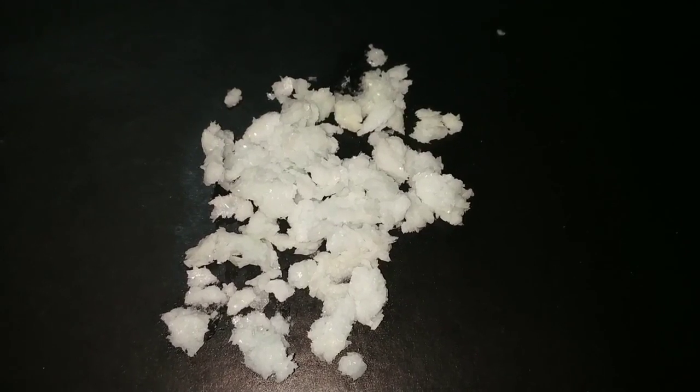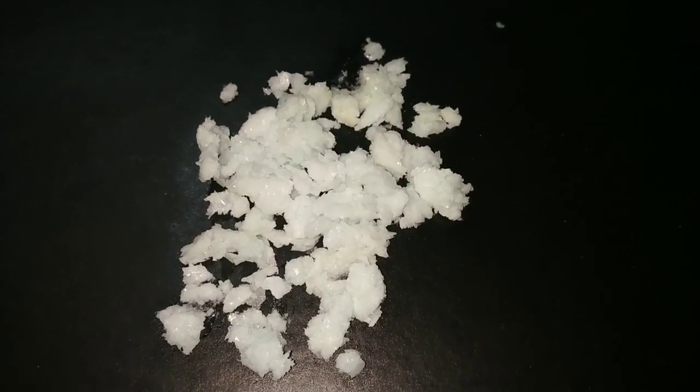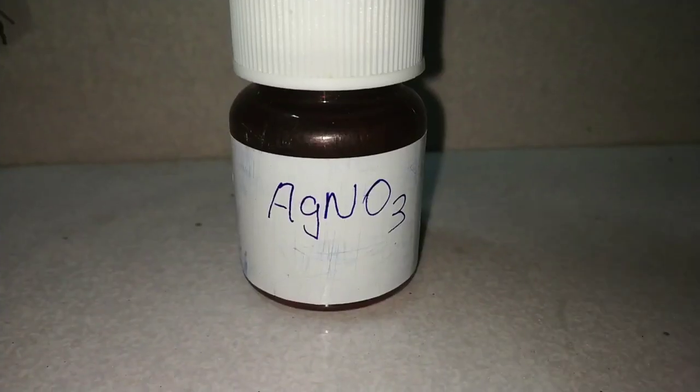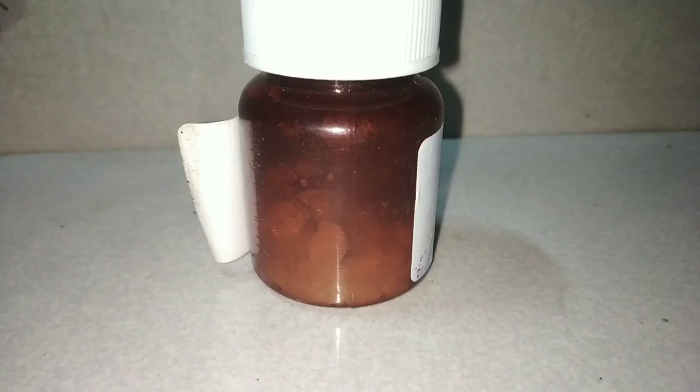And this is the final yield of silver nitrate formed. You can see the beautiful white color. Now I am storing it in a dark colored bottle to prevent photo oxidation.